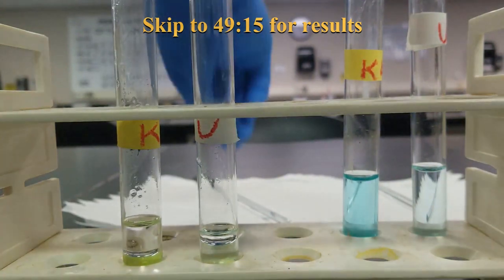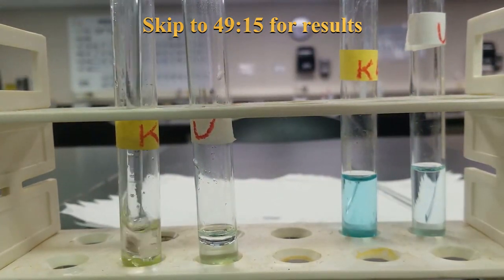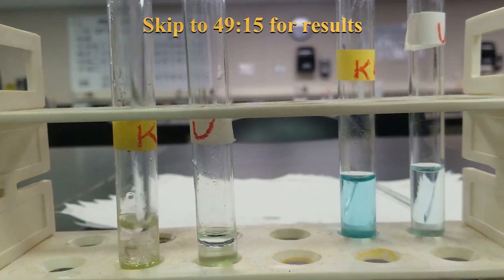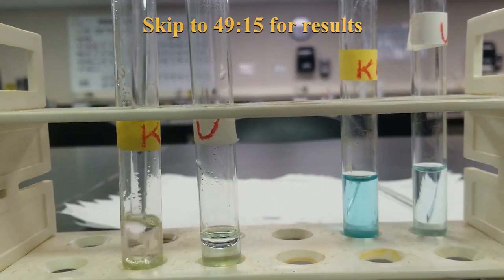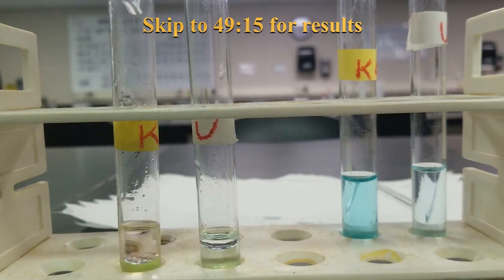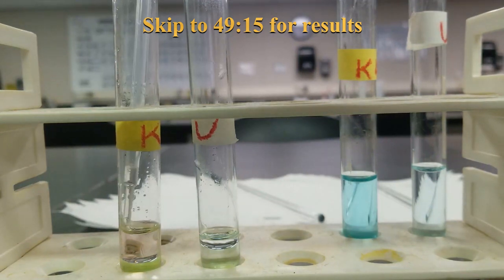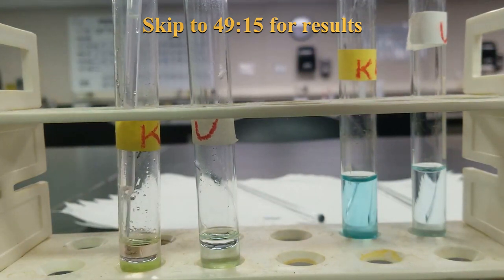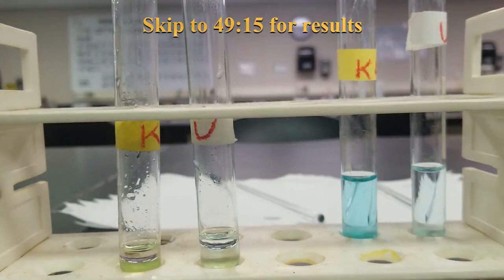Probably added way too much there. I see it's still a little pink. We're going to go with clear enough. Just pipette some of this out because I had way too much. Cool. And then let's move on to the next step. If it interferes, we'll just backtrack.